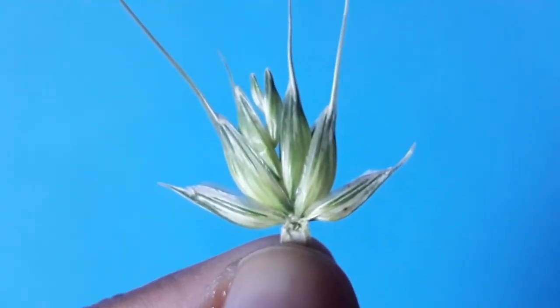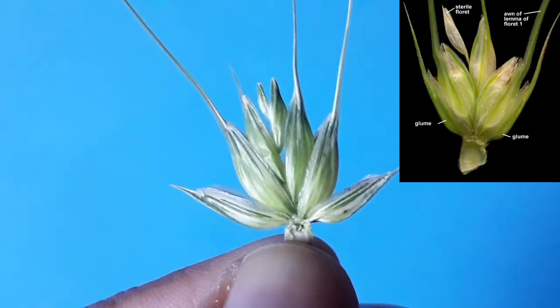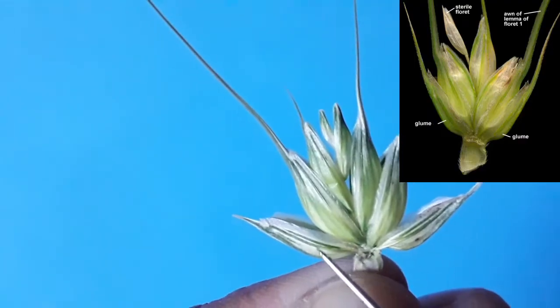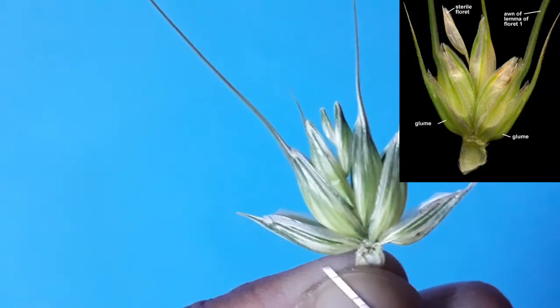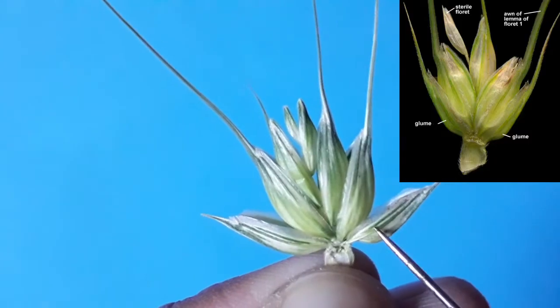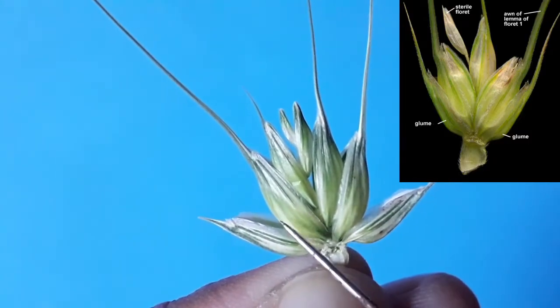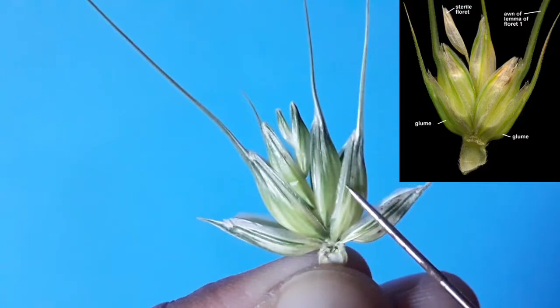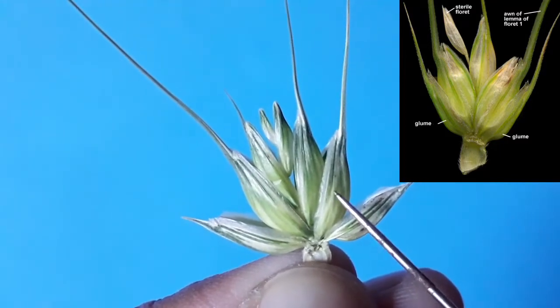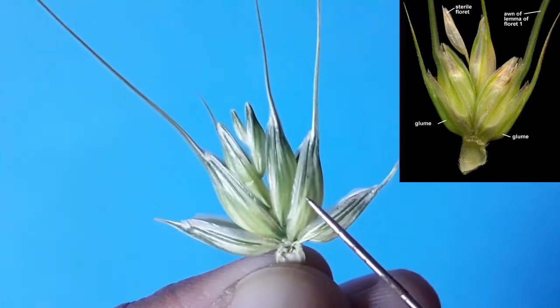Now we will move on to the practical aspect. We are going to dissect the spikelet of Triticum aestivum. As discussed in the diagram, these two structures are the glumes, designated as glume 1 and glume 2. The glumes enclose certain florets, and when we open those florets we will find certain floral structures inside.